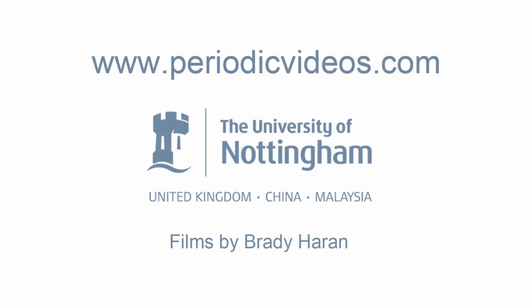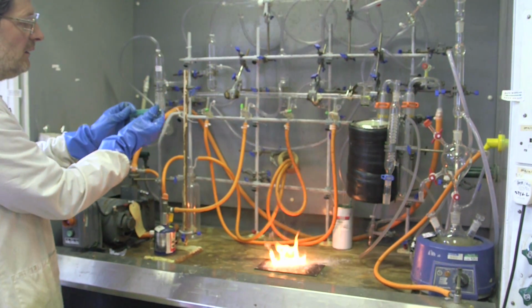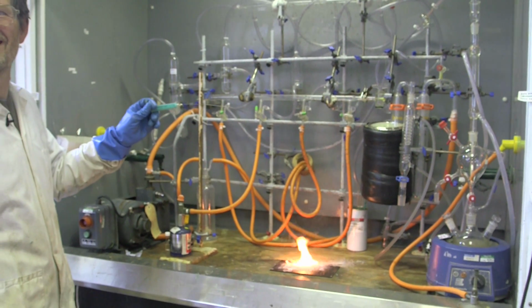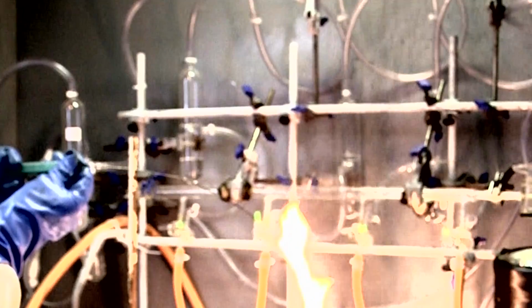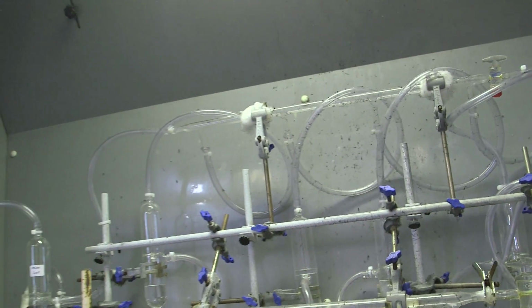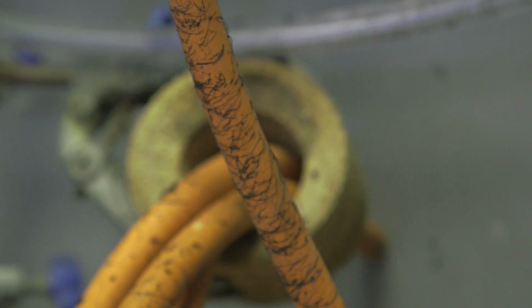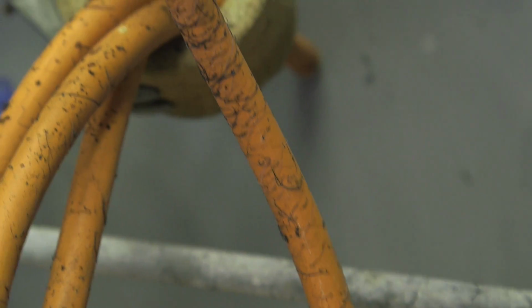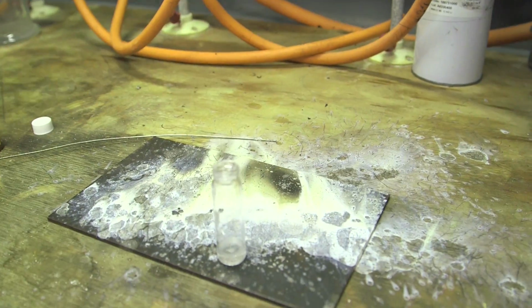3, 2, 1. And I'll be cleaning Mel's line afterwards. So the black soot you can see is actually the carbon that's been produced in the flame process. So we've oxidized up to carbon dioxide, but we've also produced a little bit of graphite there. That's unusual, actually. I've not noticed that before. So, but we don't normally spray the stuff around the lab for obvious safety reasons.